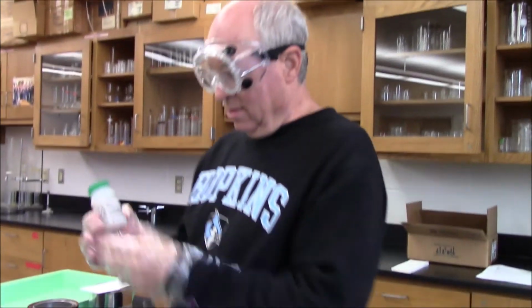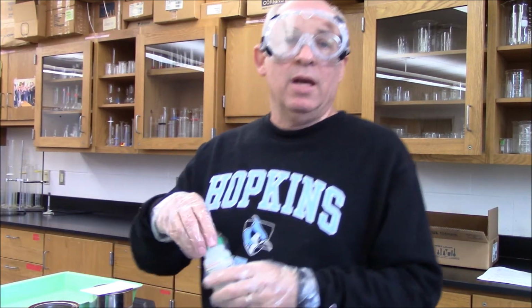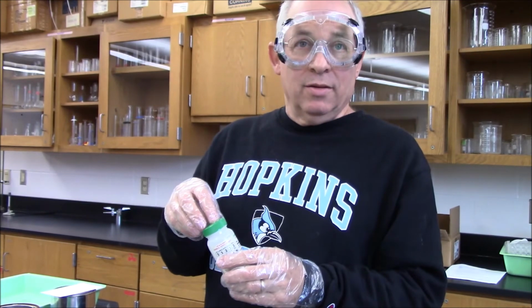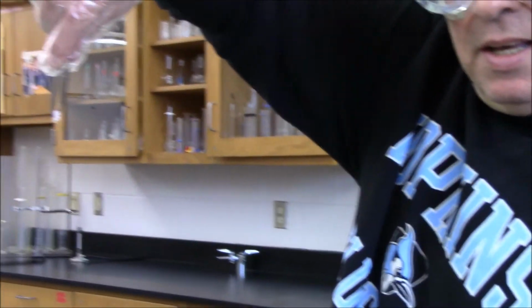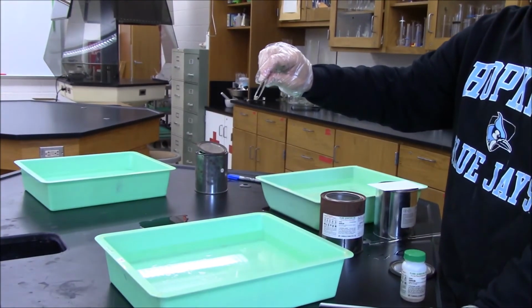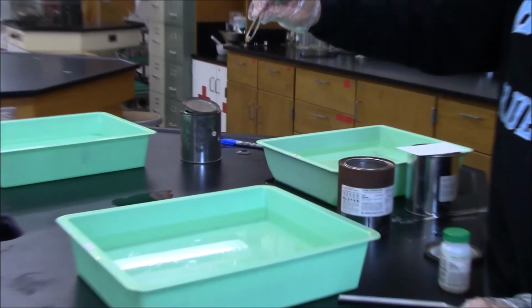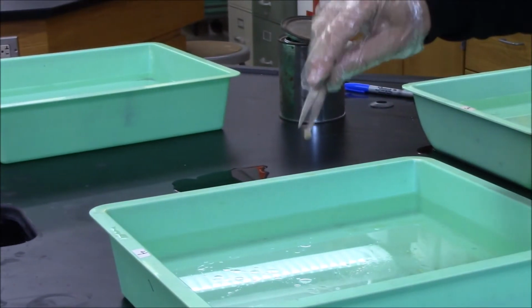Sodium in water. Here's our sodium. It's stored under mineral oil, as you can see. The sodium is given to us pre-cut. So here's a piece of sodium. You can see on the inside, it's got a shininess. Just zoom in on this. And it was actually much shinier a minute ago, but it's already reacted with the oxygen in the air. I'm going to put this in the water. And remember, we want to compare this to the lithium, and we want to compare this to magnesium, which was done on your chart. Okay, ready? Here we go.